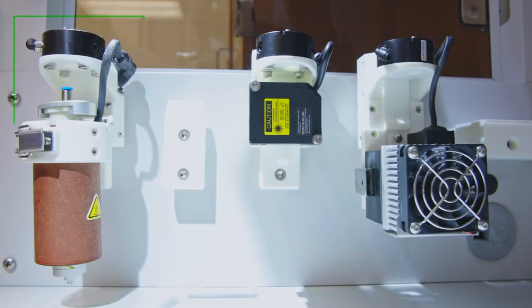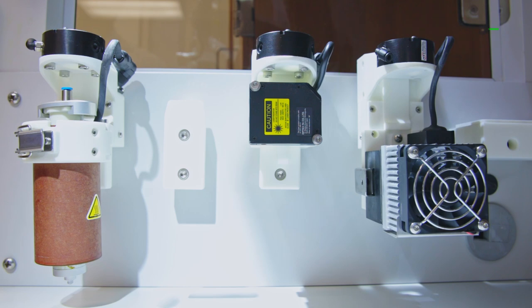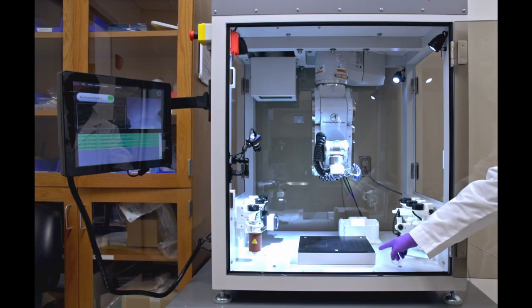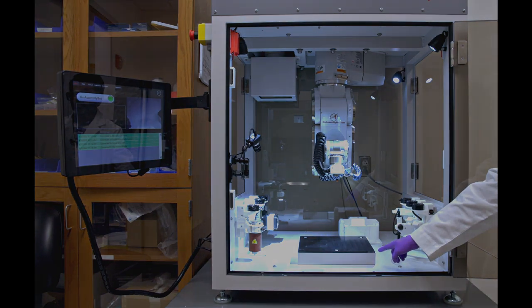The hot printhead can reach temperatures up to 150 degrees Celsius. The 3D scanner printhead can be used to scan a surface and use the scan surface as a print surface. The cool printhead can reach temperatures down to zero degrees Celsius. The print bed can be heated or cooled. It can be heated up to 60 degrees Celsius or cooled down to 10 degrees Celsius.